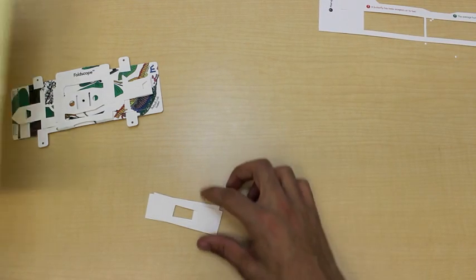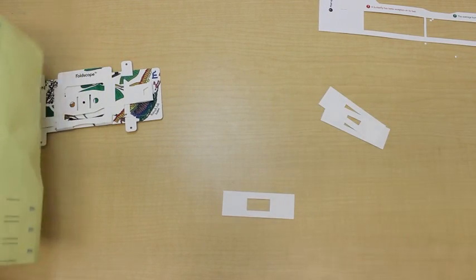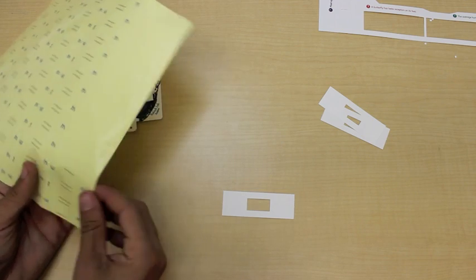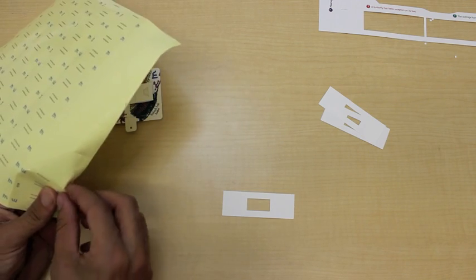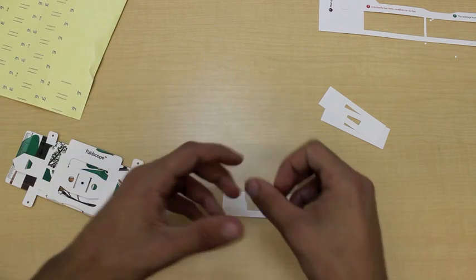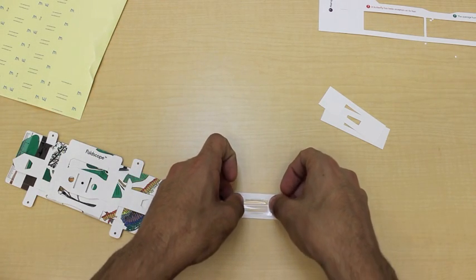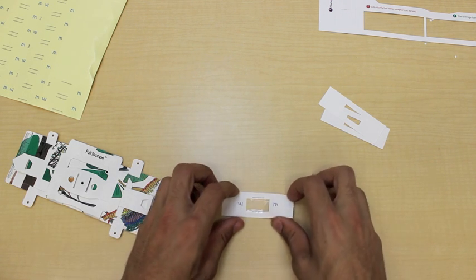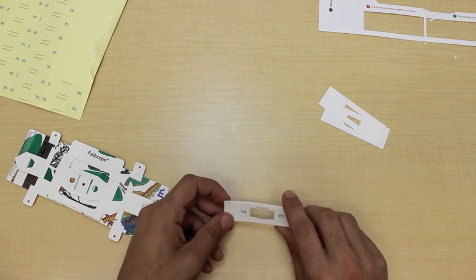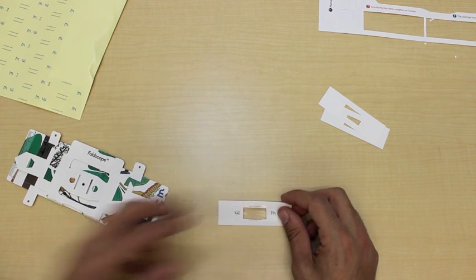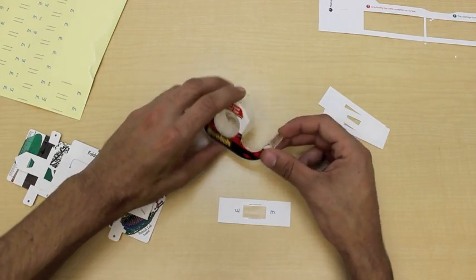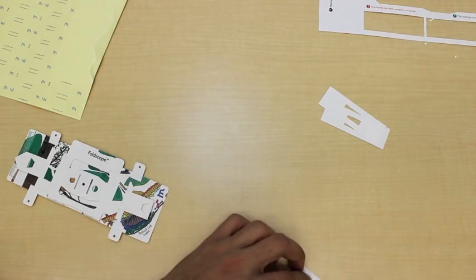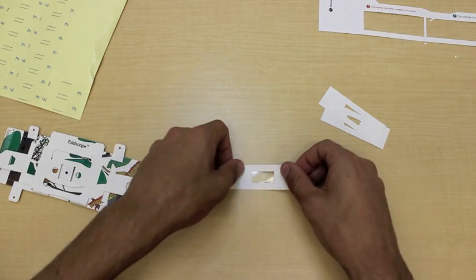Now, the first step is to take one of these slides and apply one of the stickers as a cover slip. We can peel off the sticker and place it over the hole, making sure that it sticks all around the hole and that it's centered. Alternatively, if you've run out of stickers, you can also use three-quarter inch transparent tape and cut a piece of this and place it over it. After we've done this, we can flip this over so that it's sticky side up.